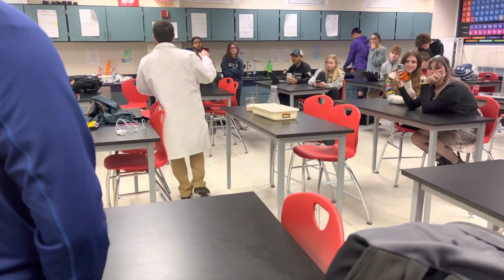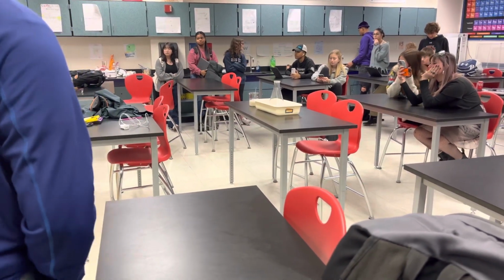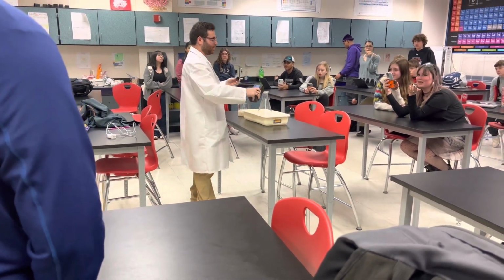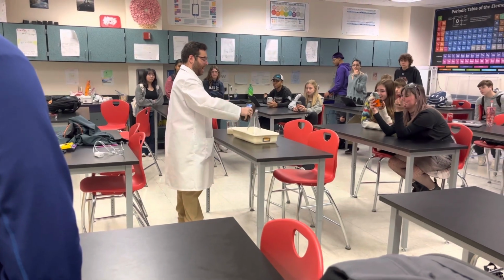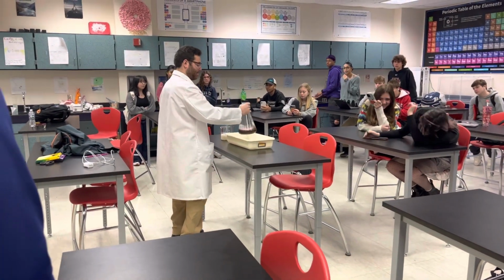I'm going to add some more. But this chunky part. But it's not going to be like a crazy explosion. So what I'm going to do is I'm going to use... You're making it seem like... I'm going to use the gas laws to kind of make it go a little bit. Let's see if it works.